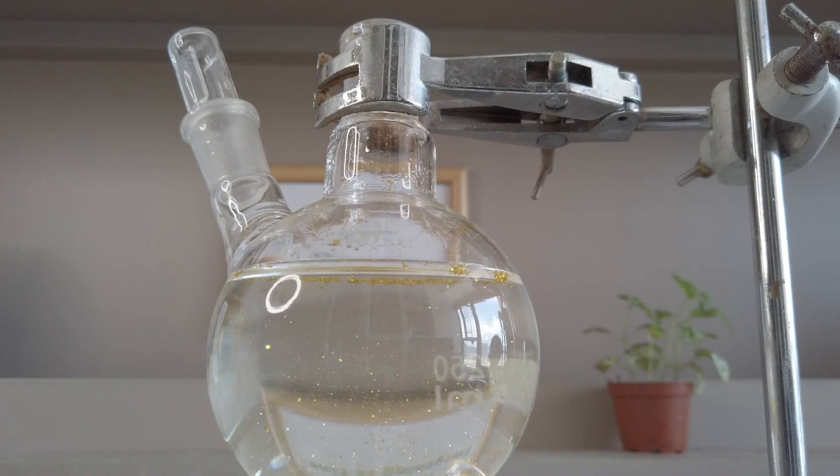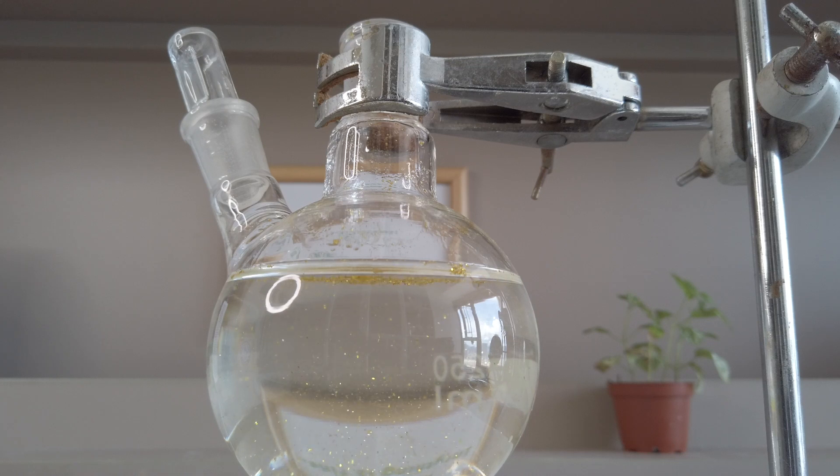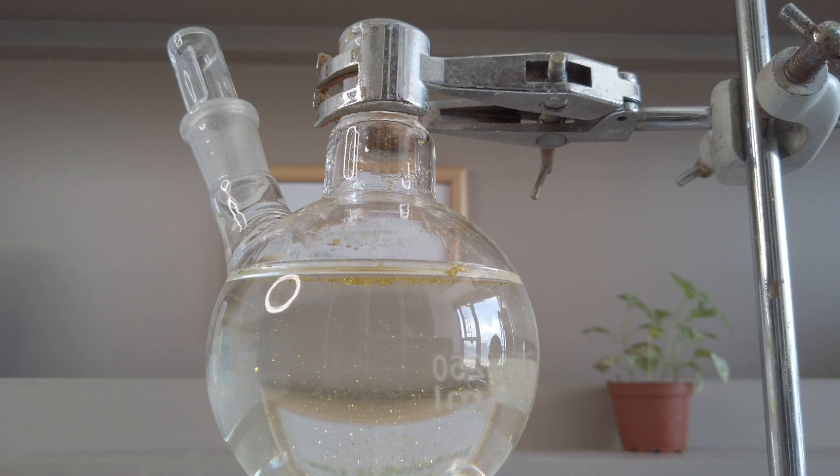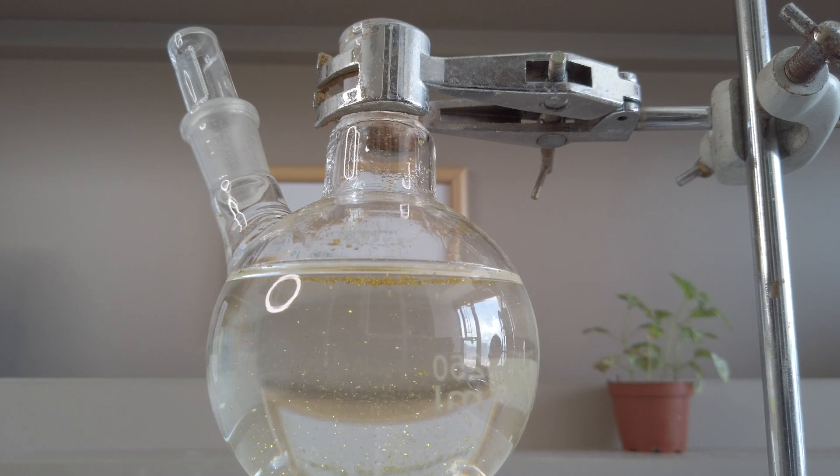Anyway, we allowed the solution to cool down for about two hours. As the temperature drops, the solubility of lead iodide decreases as well, forcing it to precipitate out in a fine solid form.